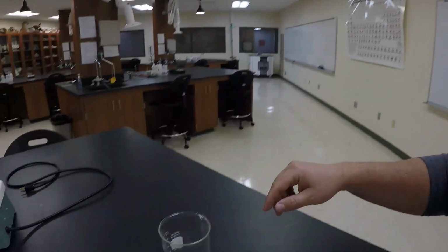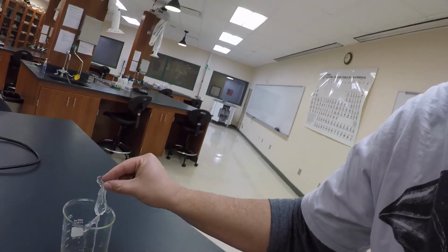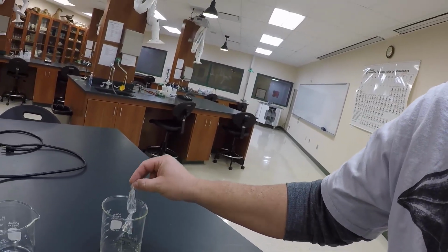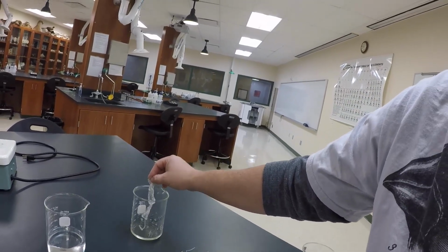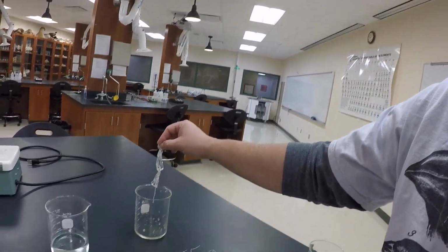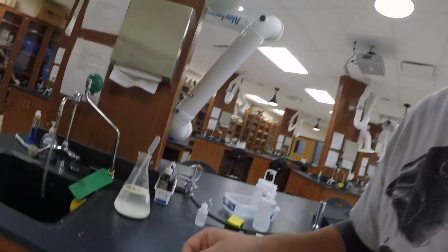So we're back, and I'm going to finish up by giving you the results of the diffusion and osmosis experiment. First I'm going to collect the results for the very last beaker, the sucrose with a dialysis bag of water in it. I'm going to try to shake off that extra sucrose, and then we're going to run it over to a scale, and I'm going to weigh it out.